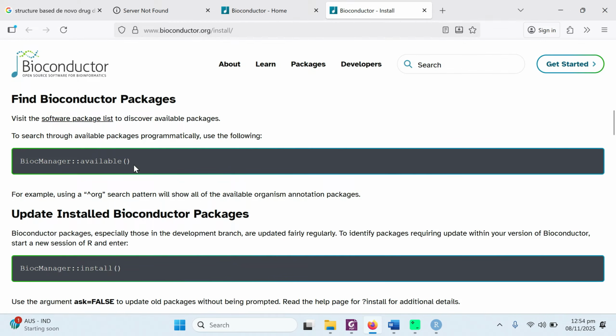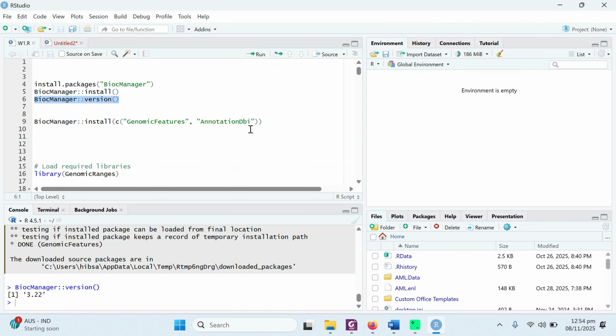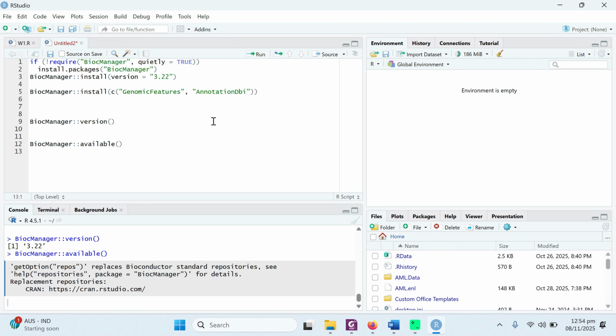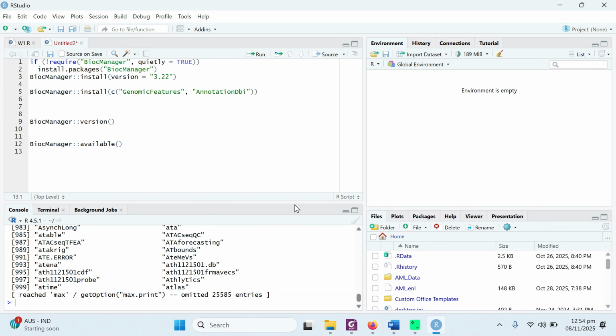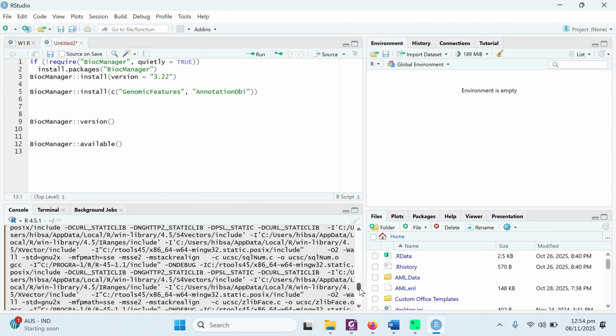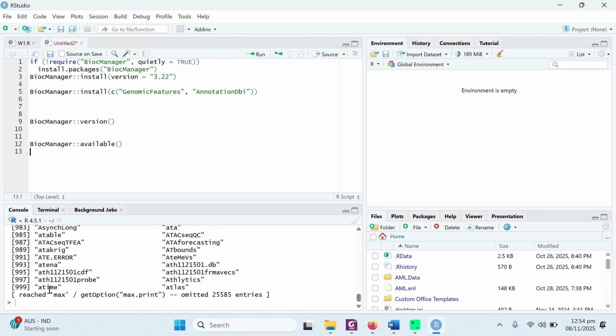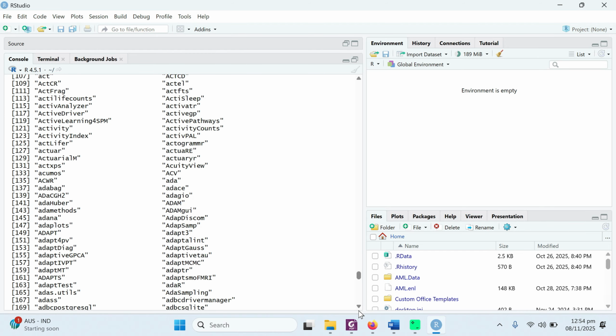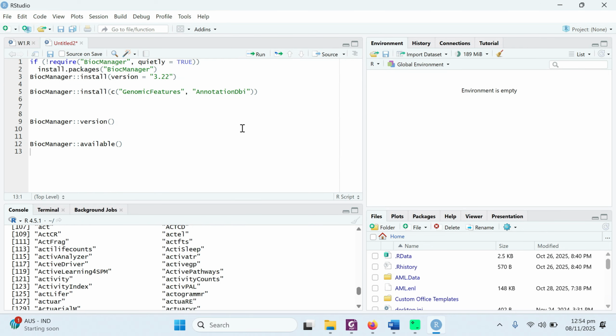Similarly, you can also find different packages. You can run this command to see what kind of packages are available. You can copy this command and go to RStudio, and in RStudio you can paste this command, BiocManager available packages. Just run this command and it will show you all the packages available. These are all the available packages on the internet. You can see there are more than 999 packages. Depending upon their function, you can specifically install them or use their values. So these are the ways you can install the Bioconductor manager, check its version and check the available packages.